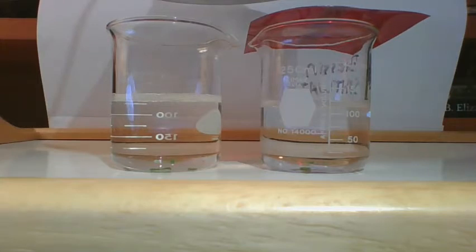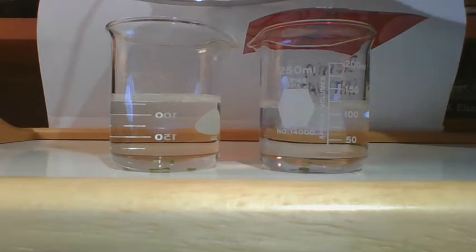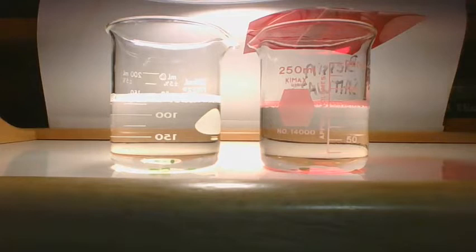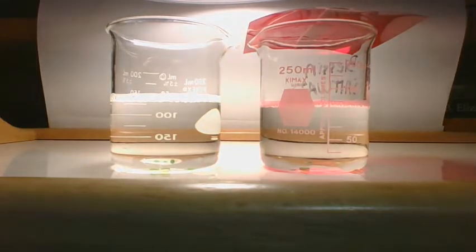It is the red video or the red filters on the right. The one without the filter is on the left. I set them up the way I said I was going to set them up in the previous video. So what I'm going to do now is turn on the light and start the clock. And I will keep track every minute. We'll watch every minute.